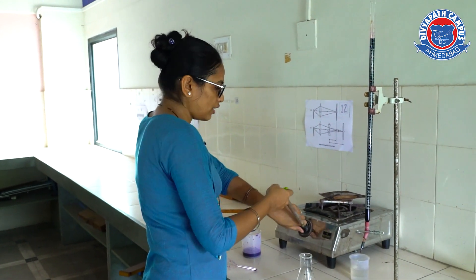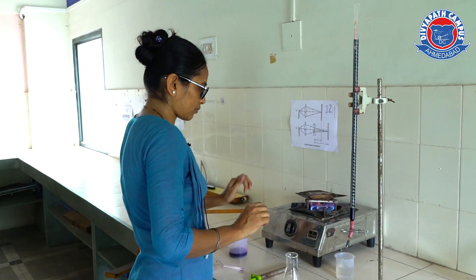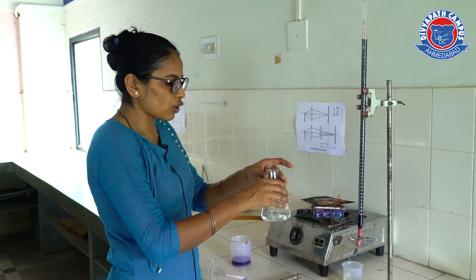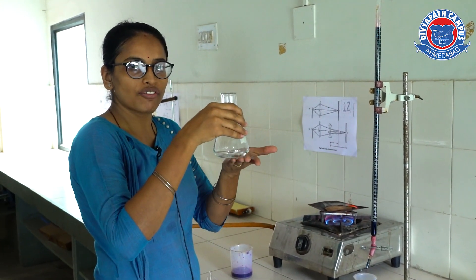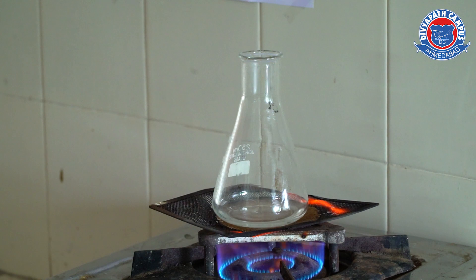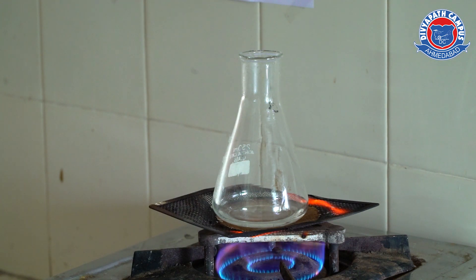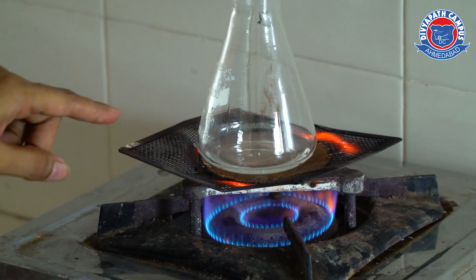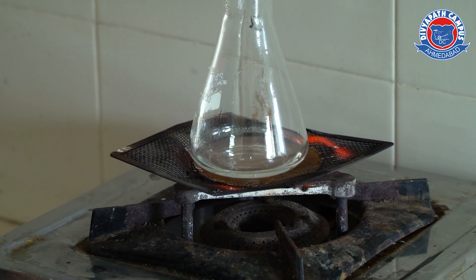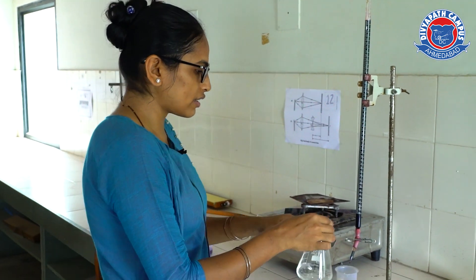The solution needs to reach 50 to 60 degrees temperature. You can see that instead of a burner, we are using a gas tripod stand and wire gauze. Make sure the lower surface of the flask is not wet, and transfer the flask onto the flame. You have to watch for small bubbles at the bottom of the flask. Now you can see small bubbles at the bottom, so the flask has reached 50 to 60 degrees temperature. We will put off the gas. You can see the fumes on the neck of the flask — this is the right temperature to start the titration.